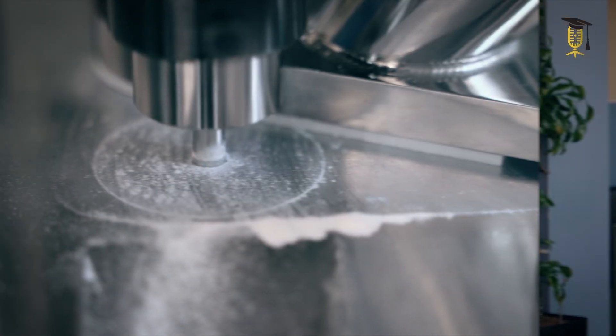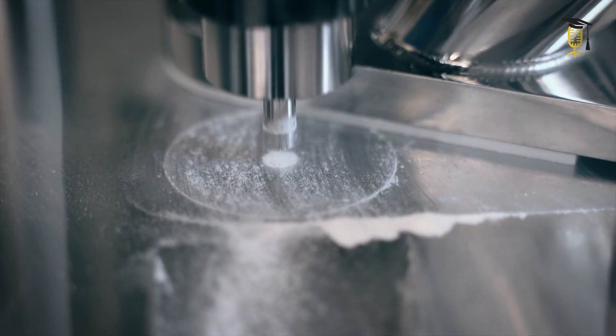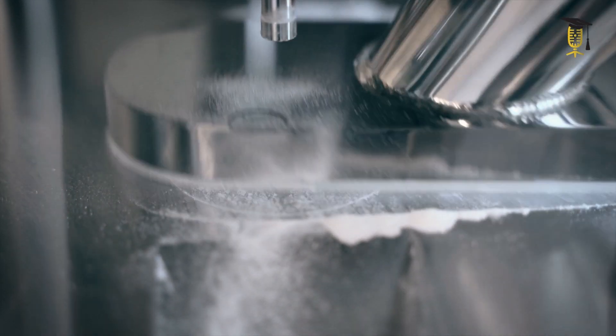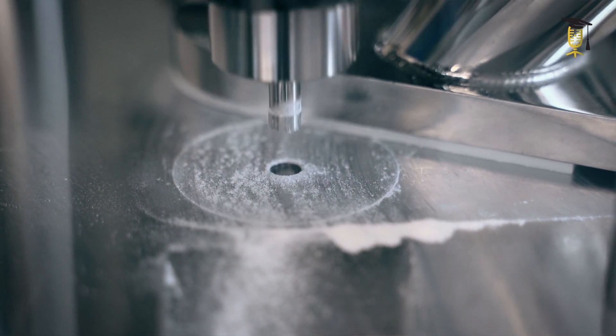In an ideal scenario, the powder flows through a big production line into a small hole. By a cylinder on top, it is compressed into a pill. Then it gets ejected, the hole is filled again, and the process starts all over.